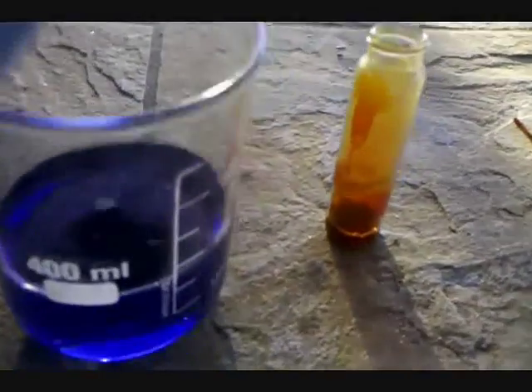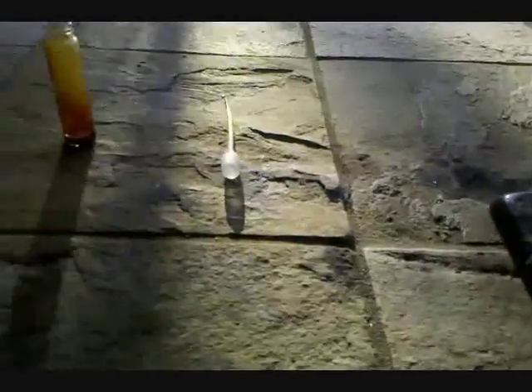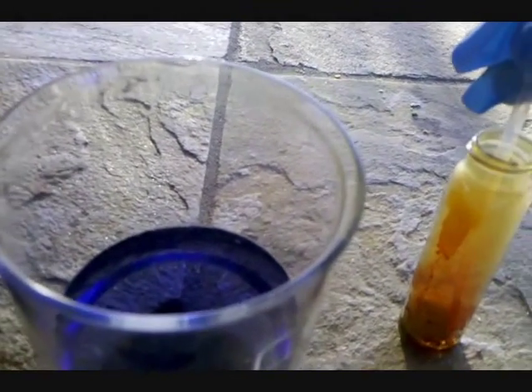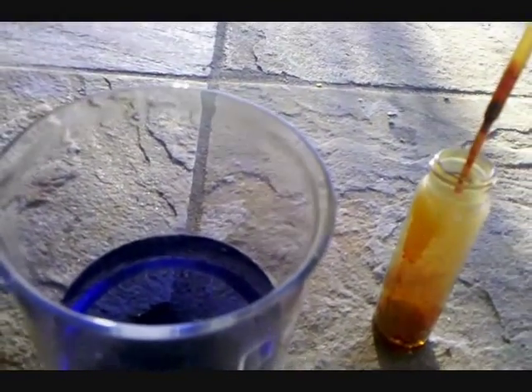Chromyl chloride is an oxidizing agent, and so for its next reaction I'm going to be showing it oxidizing sulfur. Some sulfur powder is added to a test tube. I'll take up some chromyl chloride in the pipette and add it to the sulfur.